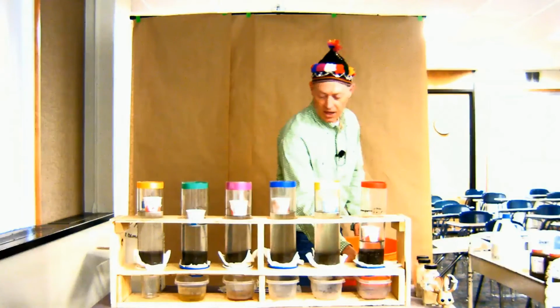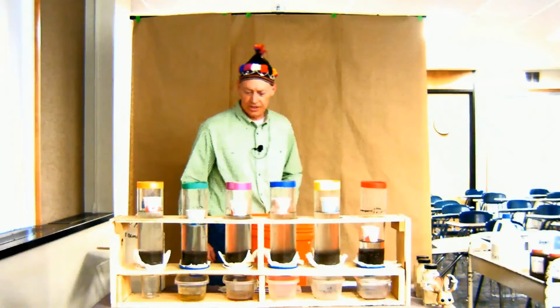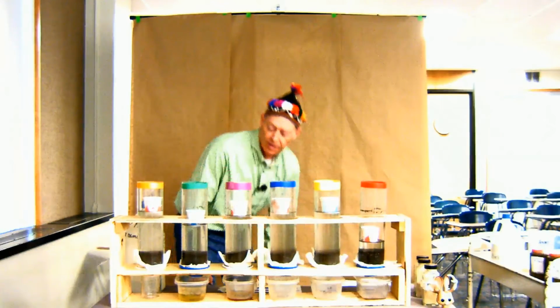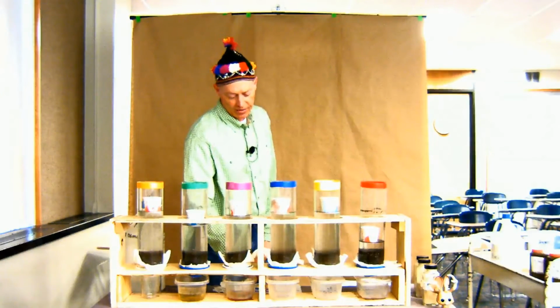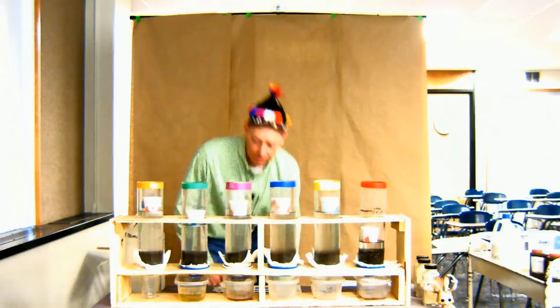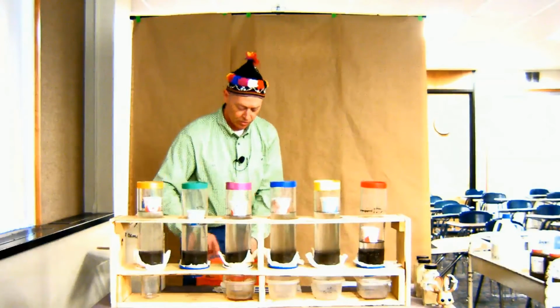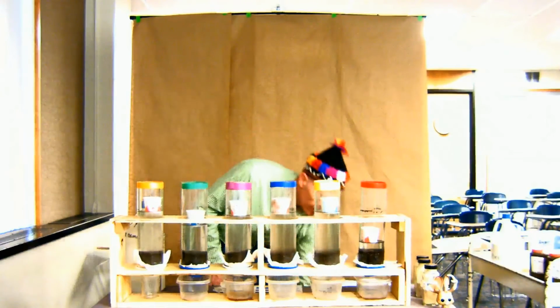Okay. And the other one that we're looking at now is the green one, and remember that was the calcium chloride, and the next one was the flue gas gypsum. So just because I'm here, I'm gonna dump the green one away too. Okay, I'm gonna let the other one sit because that one will take a little bit longer.